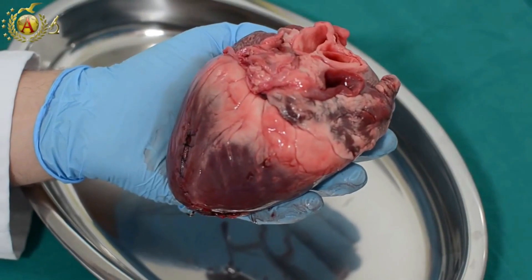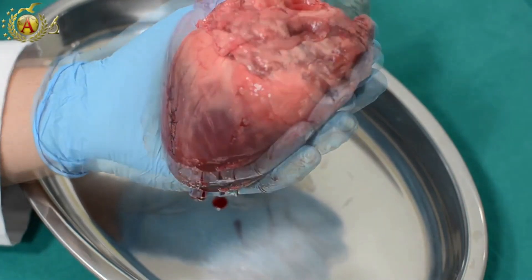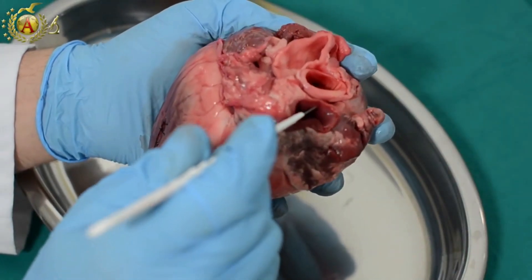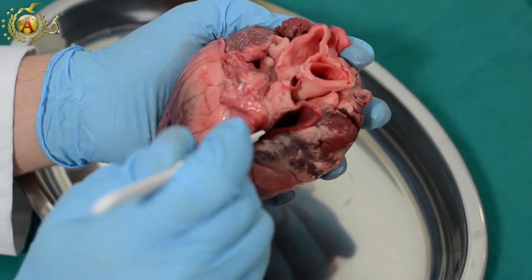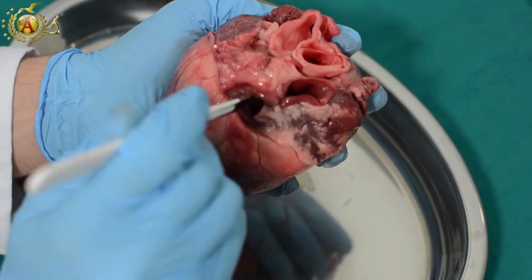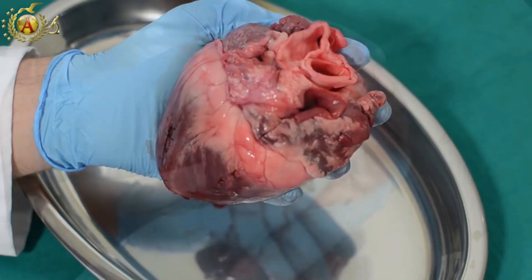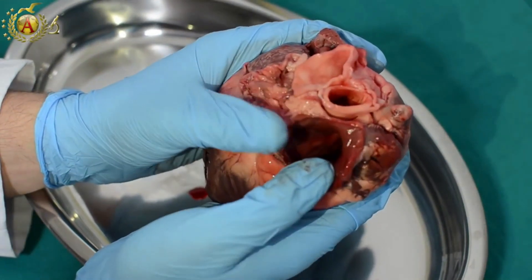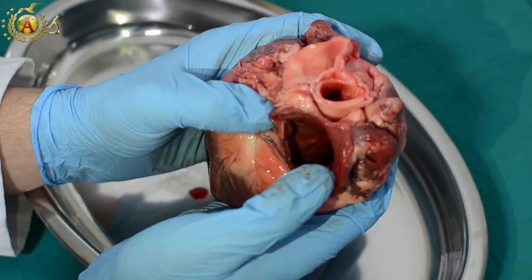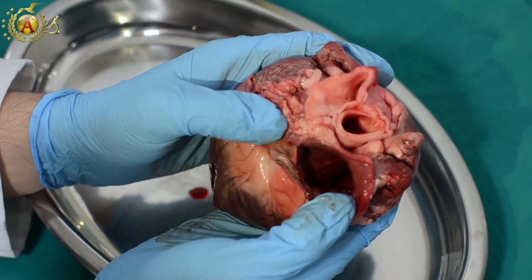Now we can proceed to the opening of the atrial and ventricular structures, beginning with the right atrium. We'll start cutting along the vena cava and follow the usual order used during autopsy, following the same path that blood does — after the right atrium, we'll go to the right ventricle, and afterwards we'll move to the left. What we see here is the inside of the right atrium along the medial wall. Even though it is not easily seen, you can feel the fossa ovalis, a residue of the foramen that connected the two atria during intrauterine life.